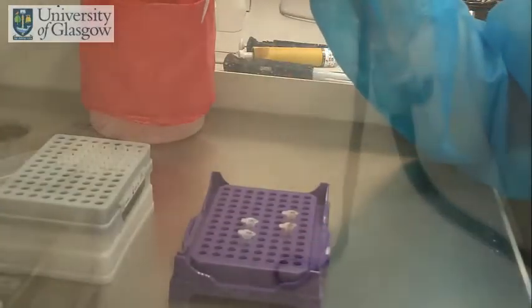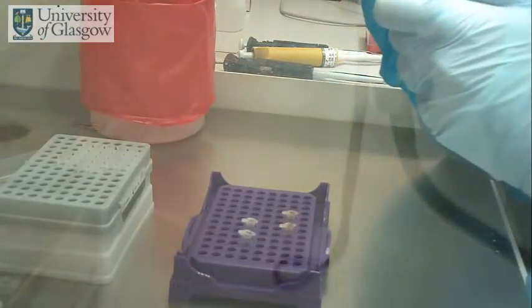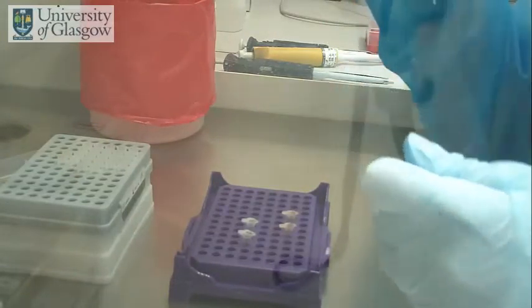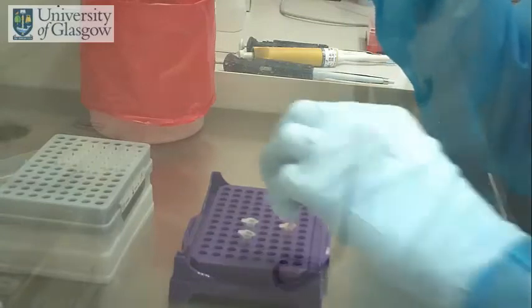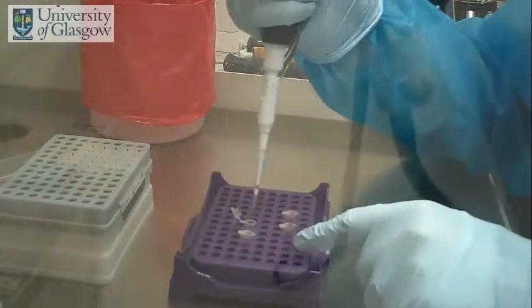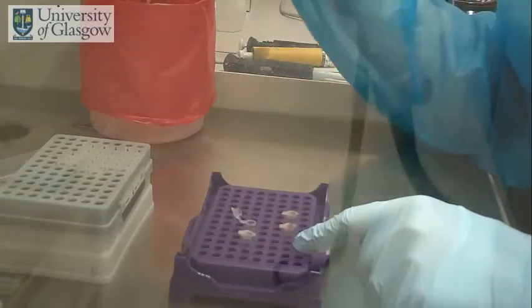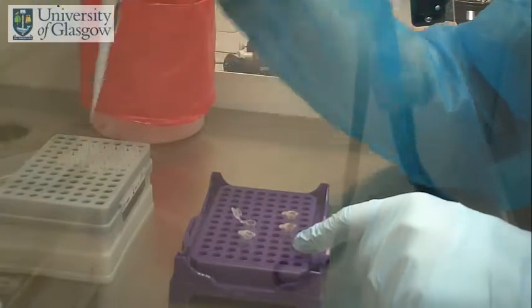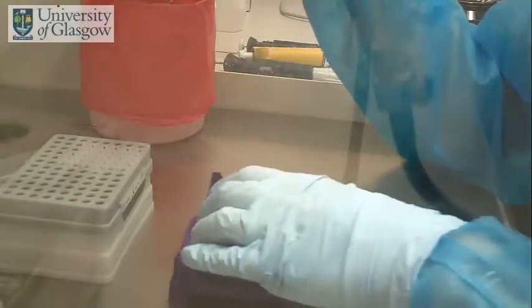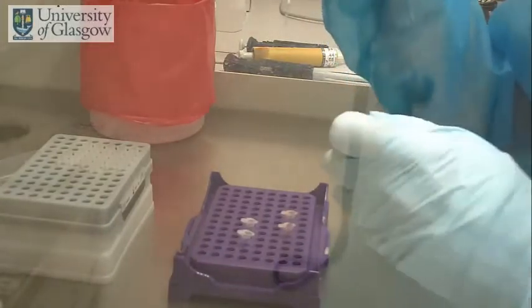Once the tubes have been boiled and cooled, the sample is then ready to be loaded into the PCR reaction tubes. So here we have the reaction tubes which have already been previously made and tested. They're made in batches to make sure that the mixture is consistent. We add our 5 microliter sample to each respective tube. So we have tubes for all our controls and tubes for all our samples and spikes.